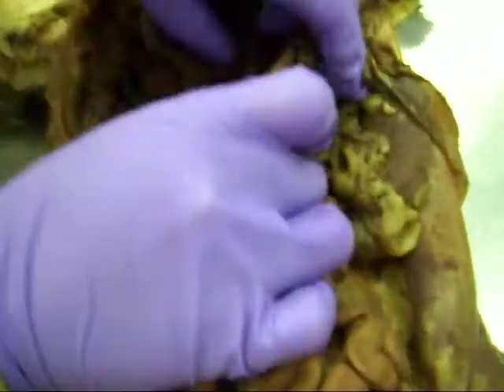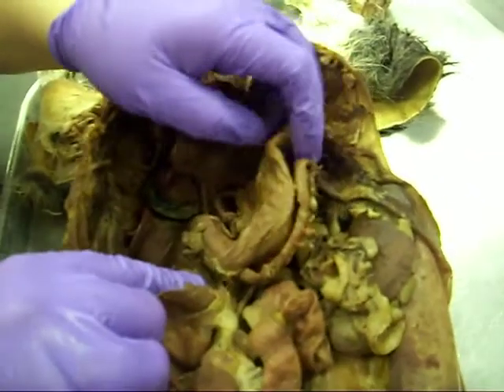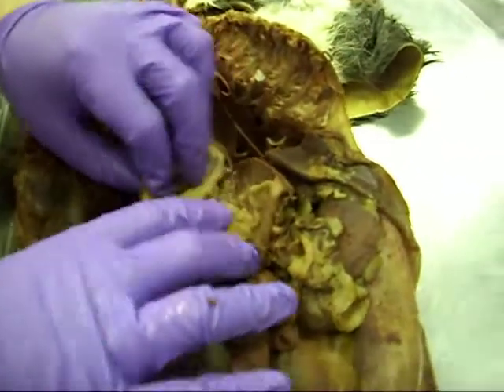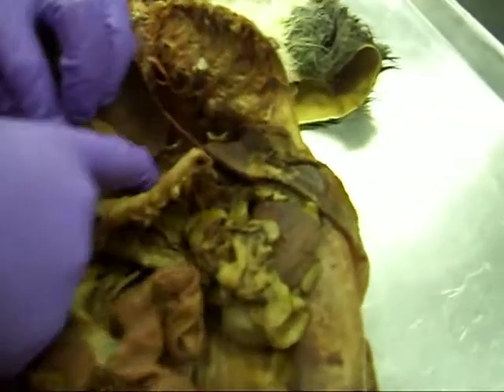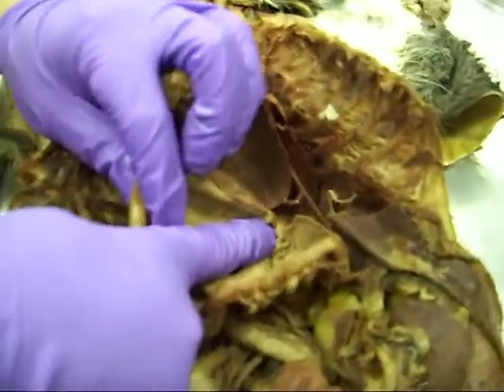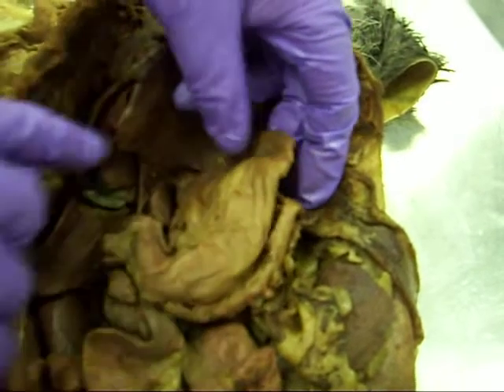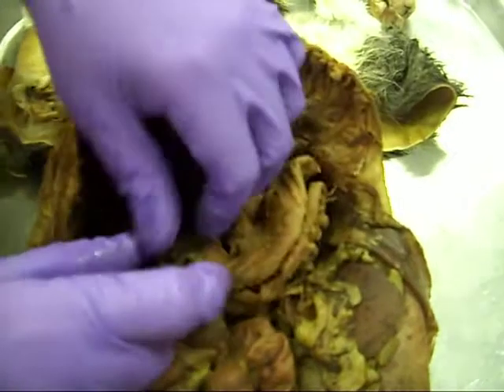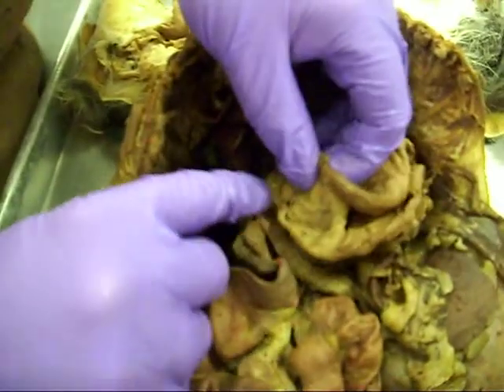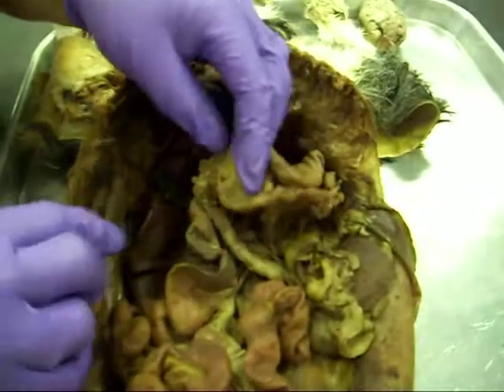Let's look at some structures in the digestive system. I actually dissected the stomach so that you can see inside — we're going to look inside the stomach. There's the rugae, all the ridges in the stomach. The top of the stomach there is your cardiac orifice and cardiac part of the stomach. Then the shape at the top is the fundus, the body, and then the pylorus region. The pylorus is the sphincter — you can barely see it, but you can see that enclosed region where it goes from the stomach to the duodenum.